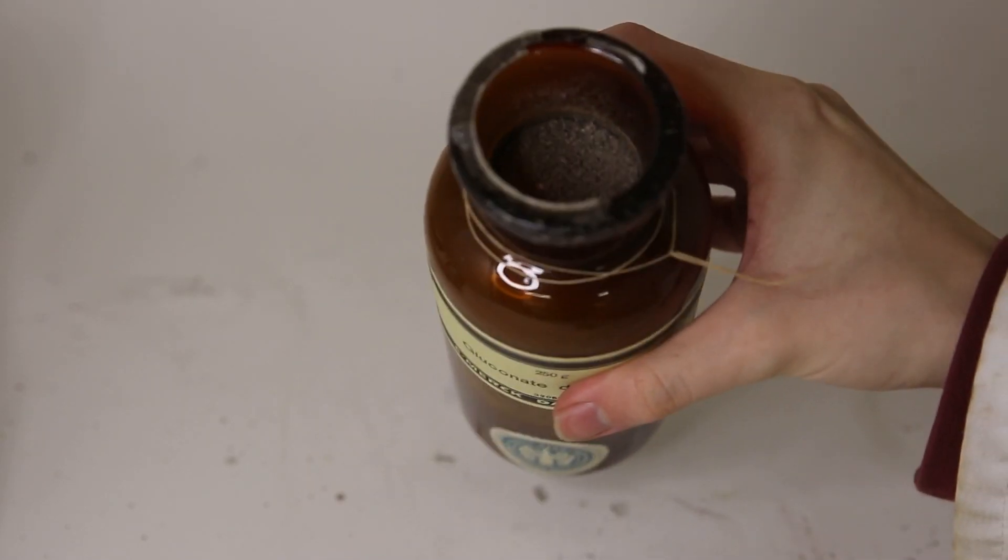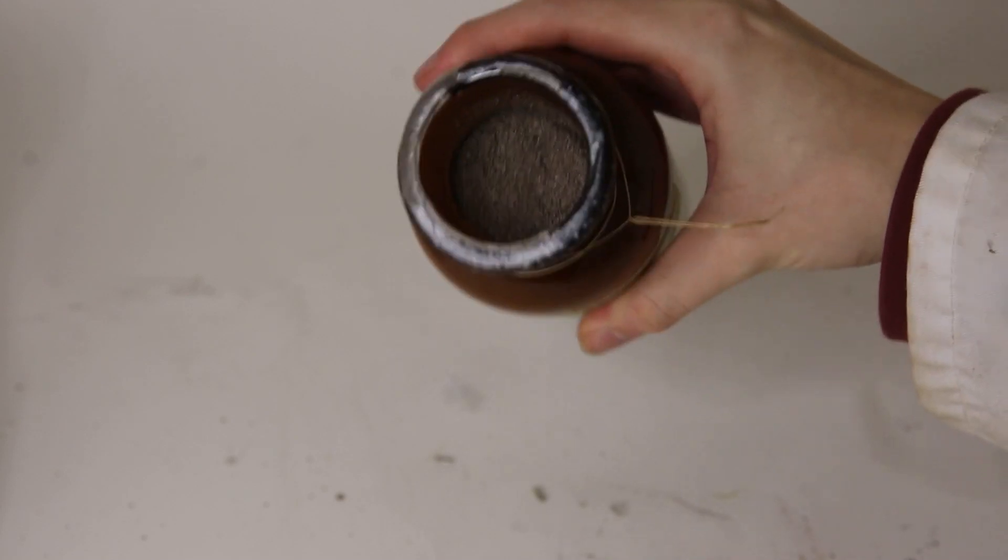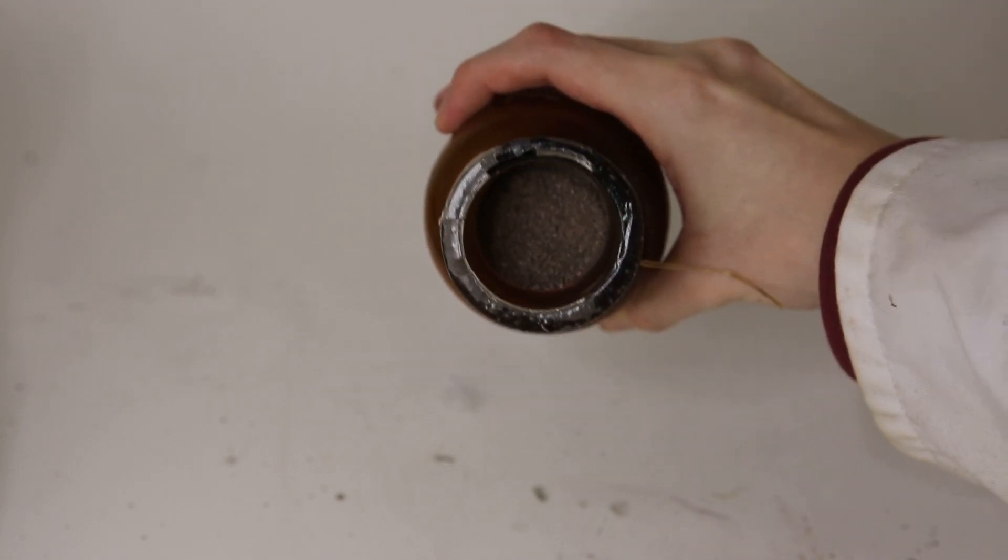So this is what the inside looks like. It's just a blackish powder. Now let's get everything out and we can take a closer look.